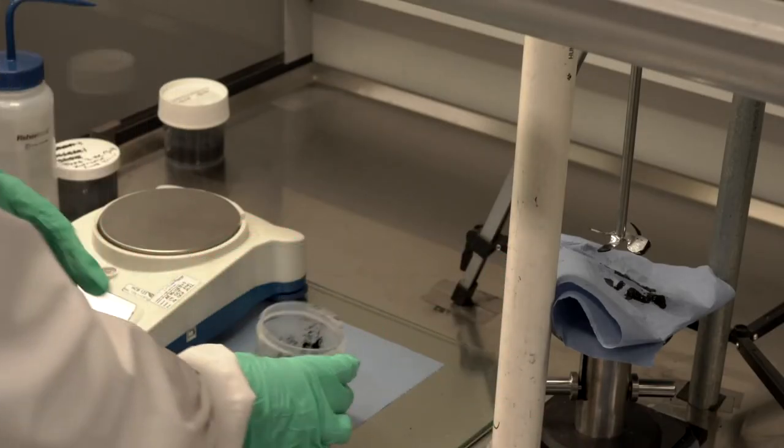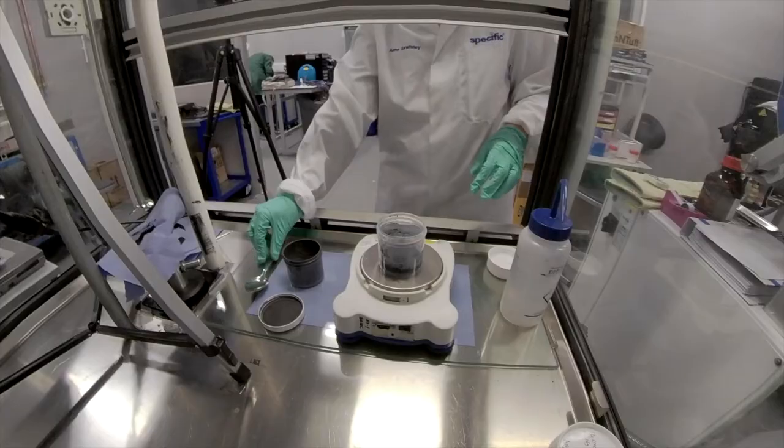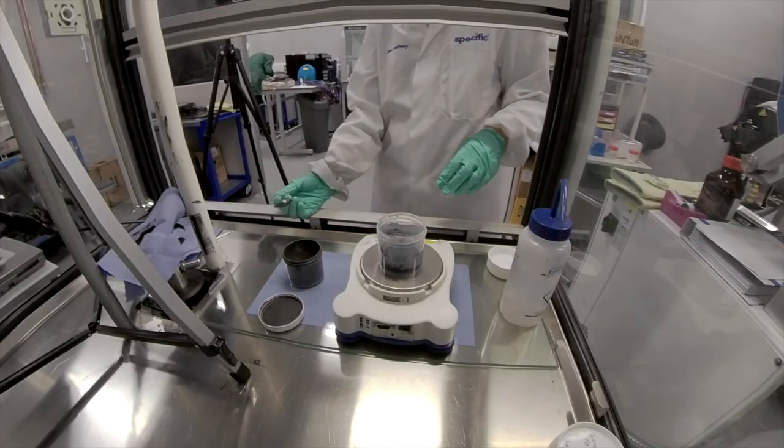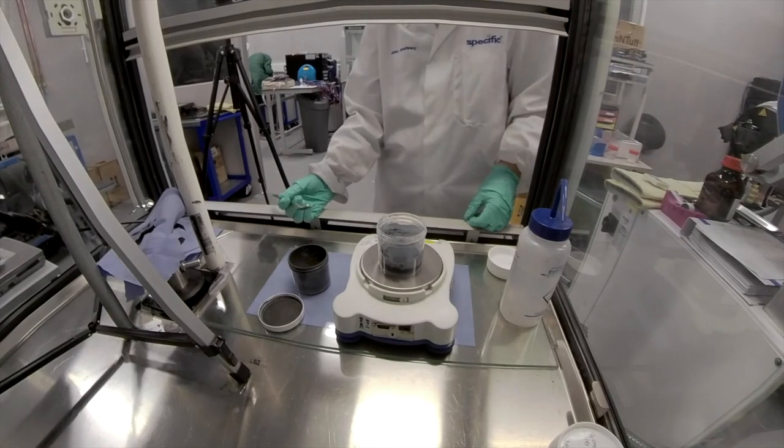The next step is to add the hard carbon. I want 11.2 grams of hard carbon into my cup.